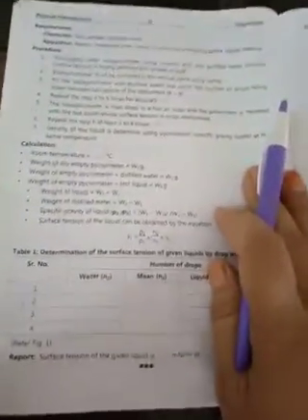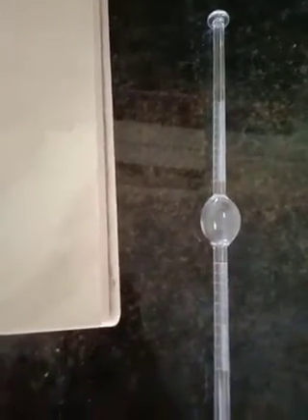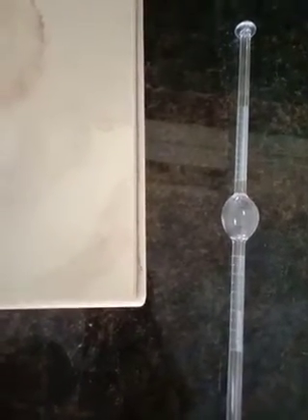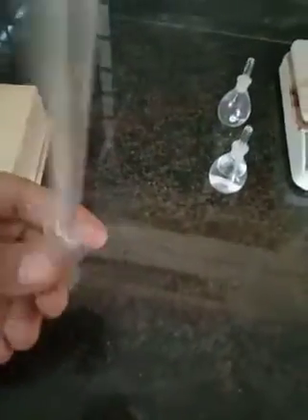The unknown sample will be compared with the reference. First, we clean the stalagmometer thoroughly using chromic acid and purified water, because surface tension is highly affected by grease or dust. We ensure no particles remain. This is our cleaned stalagmometer.